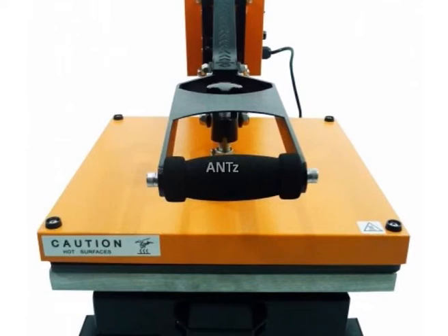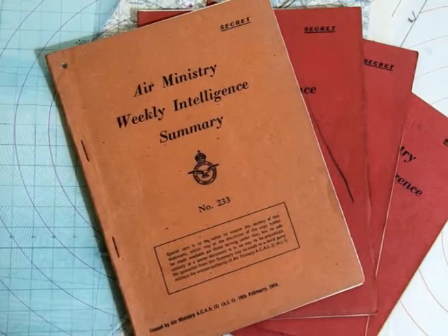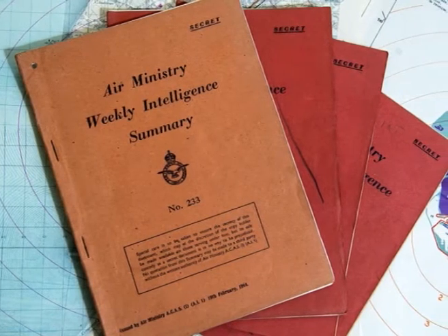Regarding the arrangement of platen: the questioned sample is placed on top of the flat platen surface with some space on the platen to allow the film to charge. The electrostatic detection apparatus works on a single sheet of legal-sized paper. Mostly the second sheet is taken to decipher indentation because it is a replica of the original handwriting. Deep or heavy indented writing on a page should not be taken for examination because ESDA fails to decipher deep indentations — in that case, the third or fourth sheet can be used as it will have normal indentations.